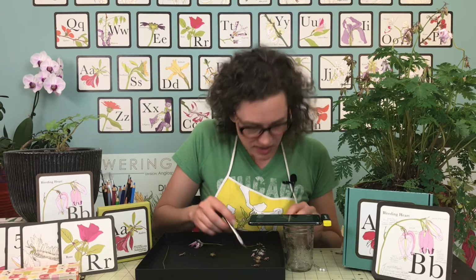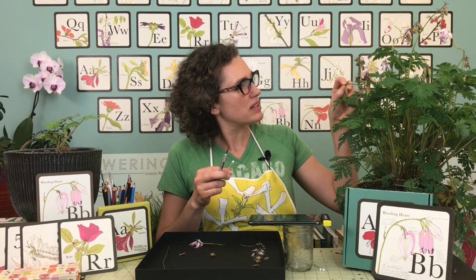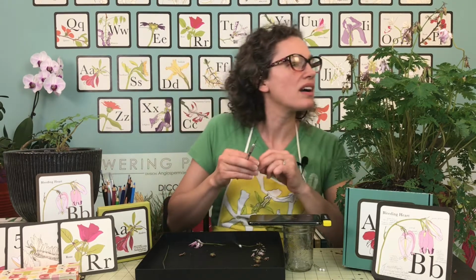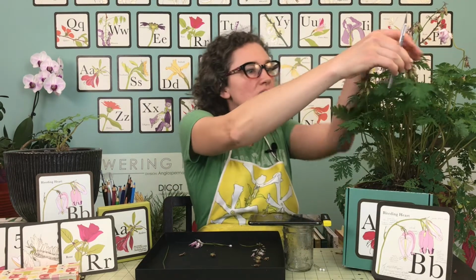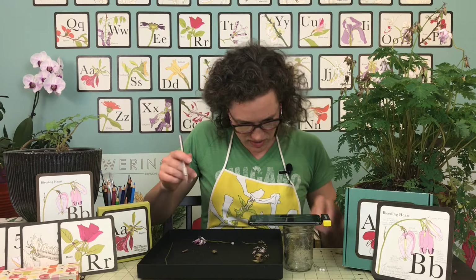And then let's see if we can find a really fatty one. I bet we can. All right. Oh, you know what? I think this one's gonna be good. All right, so before we get to our one that I had for last, let's see if we can look in here.